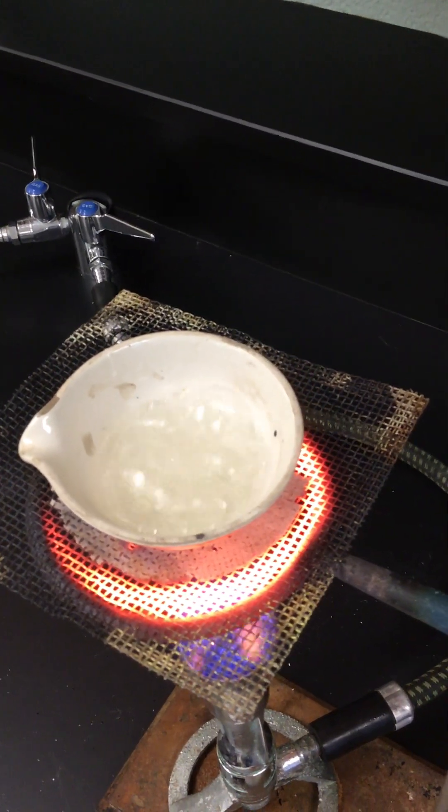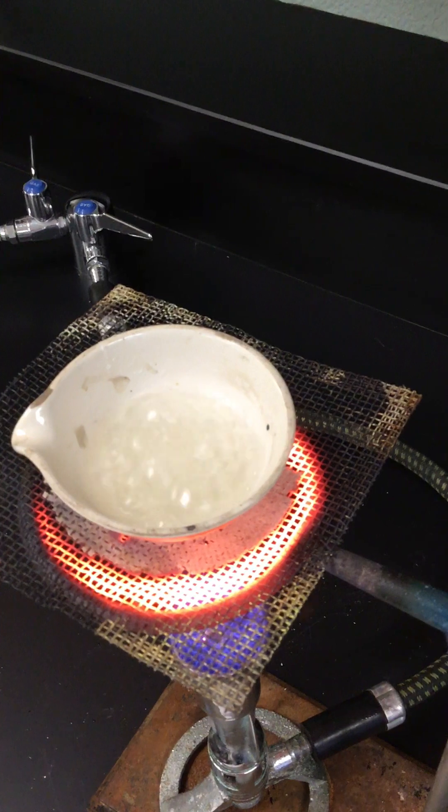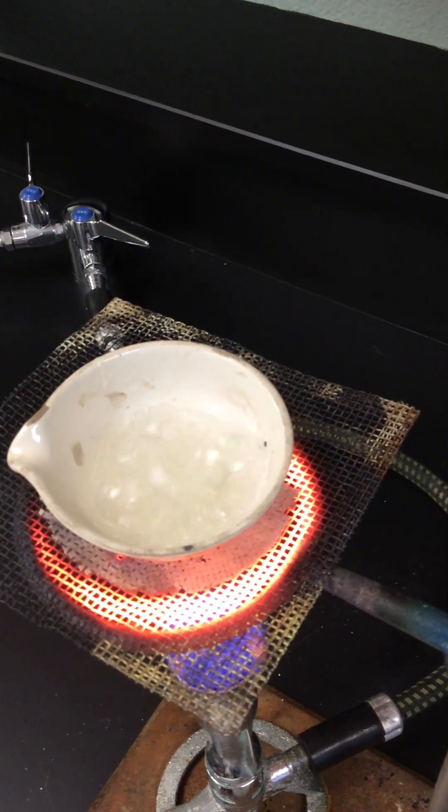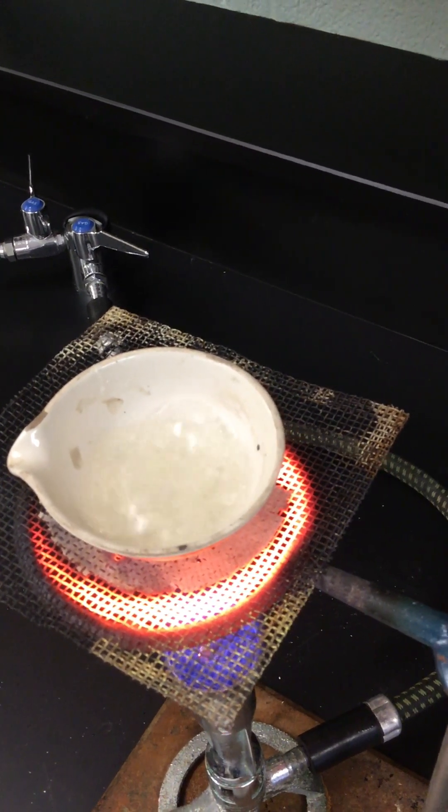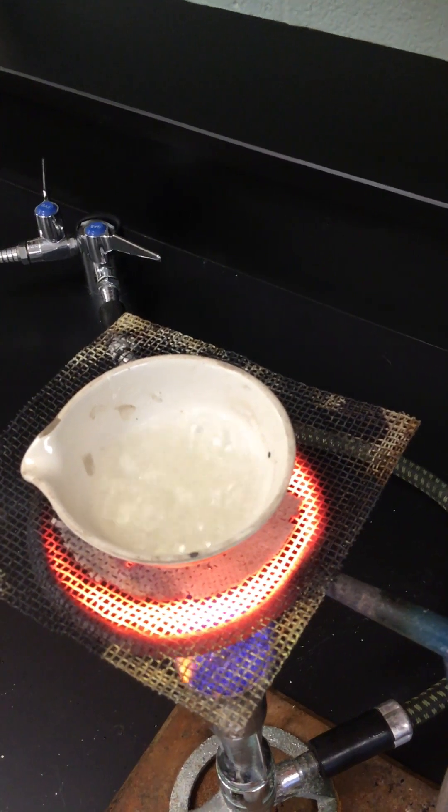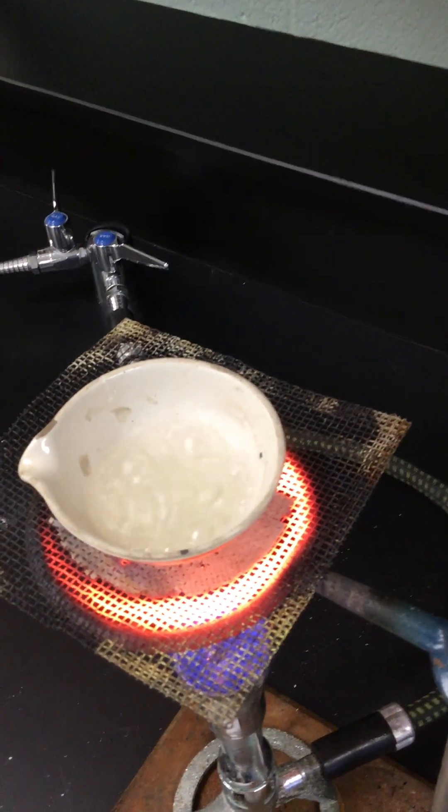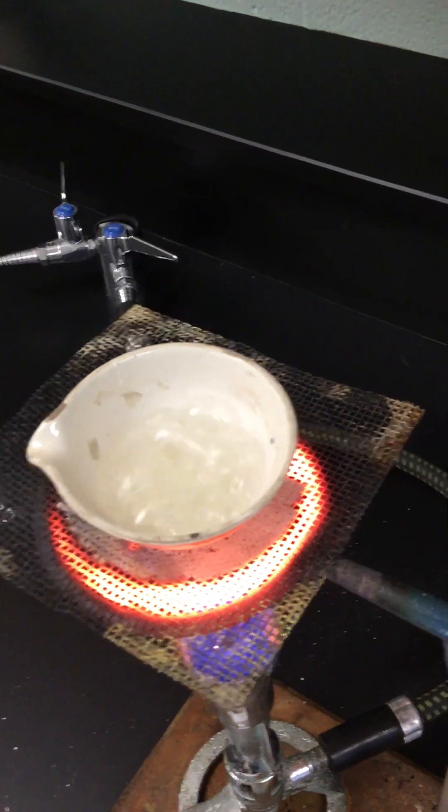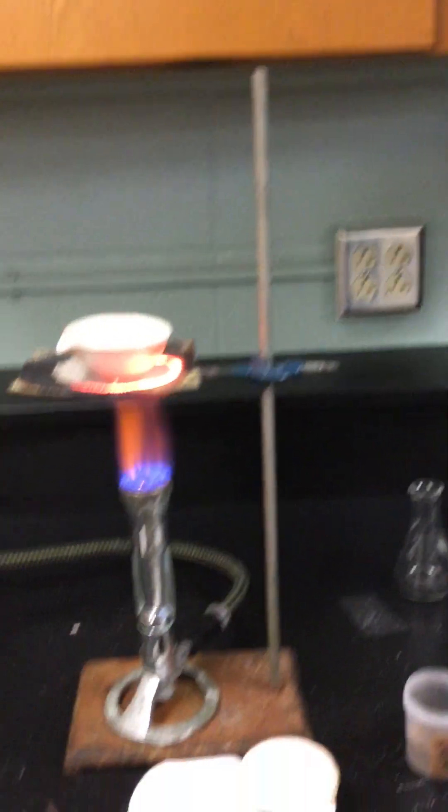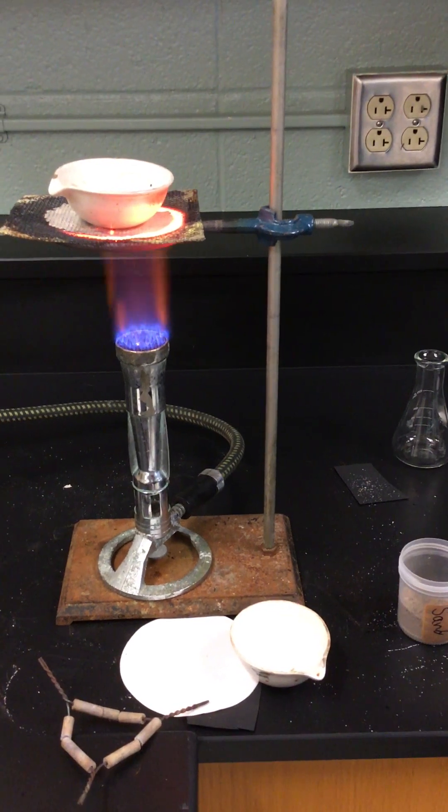And you can see bubble bubble toil and trouble. I'm trying to quote Shakespeare but I don't remember what it is. So you know, boiling, yes, happening right here. Were you in person you would be doing this. I use this lab as my introductory activity to lab safety.